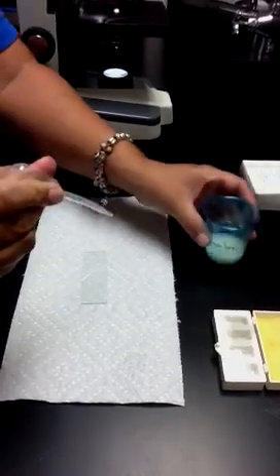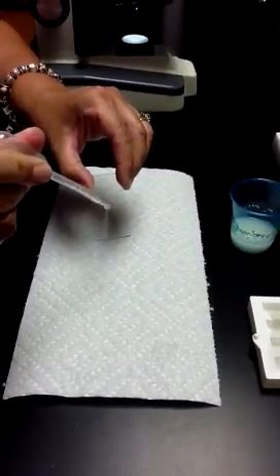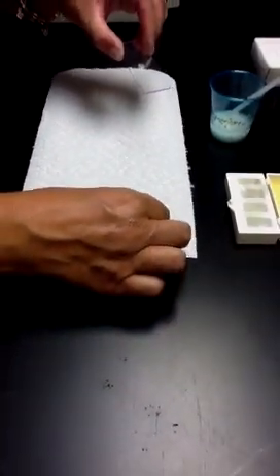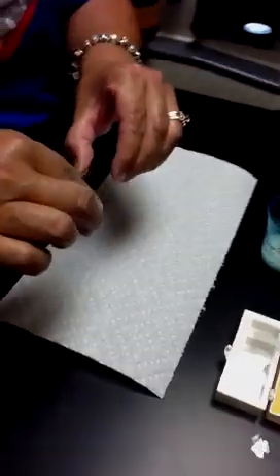I'm going to take a small drop of that solution and put it on a slide, really just that much. It's a very tiny drop. And I'm going to slowly lower my cover slip onto there and avoid air bubbles.